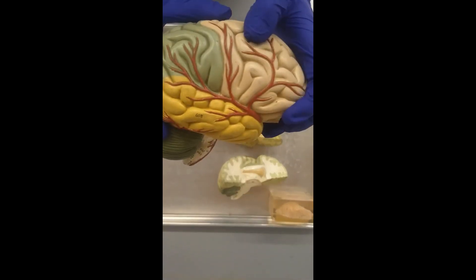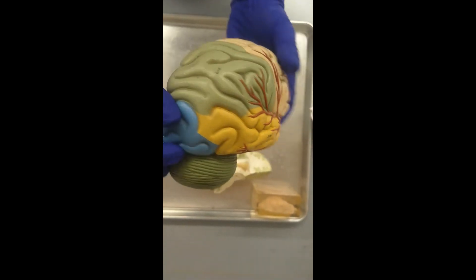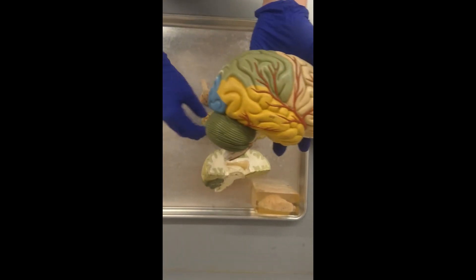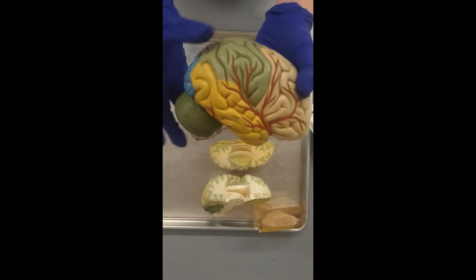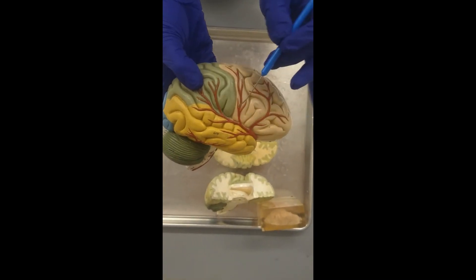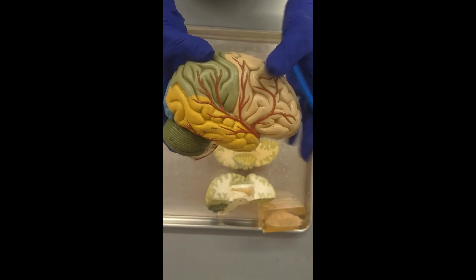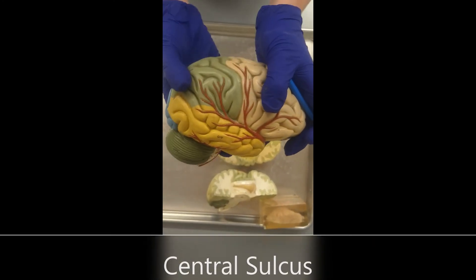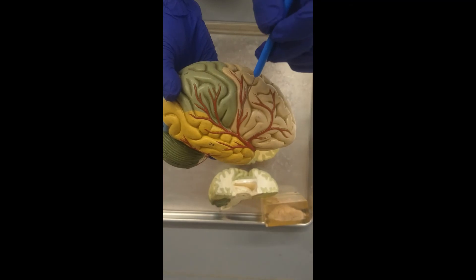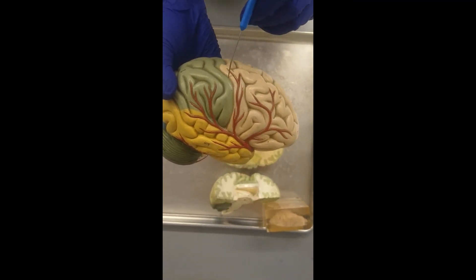So we've got frontal, parietal, temporal, and occipital in the back. I want you to identify the central sulcus — the central sulcus is going to be in between the frontal lobe and the parietal lobe, right here.